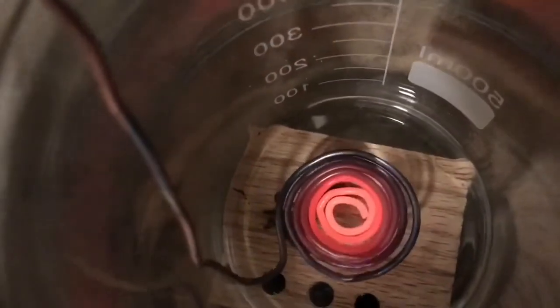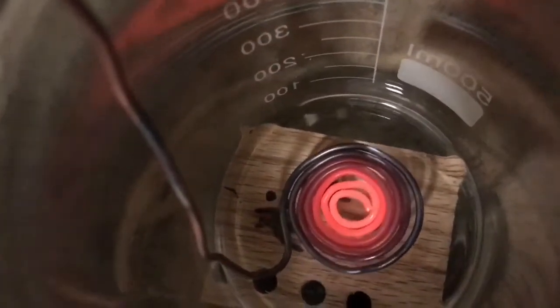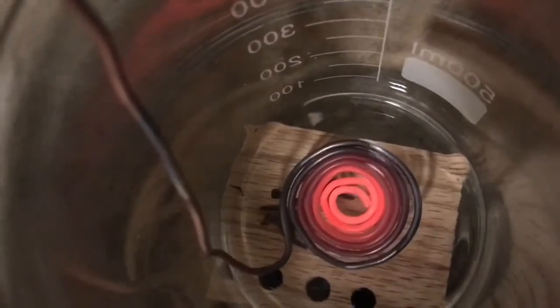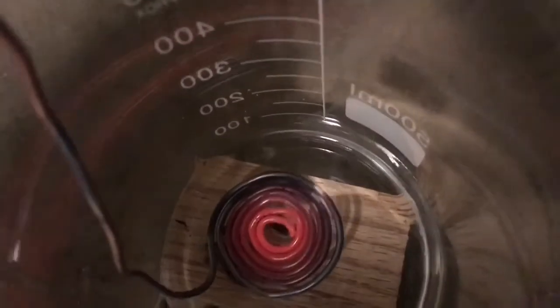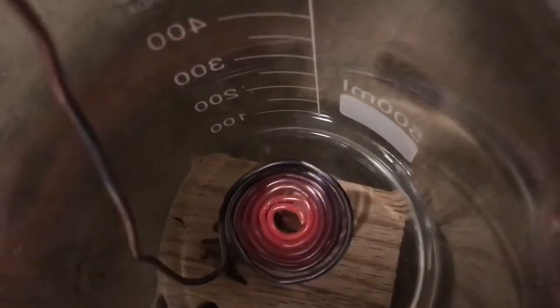Copper plus rubbing alcohol, catalyzing the decomposition of the rubbing alcohol. You can see waves of oxide forming on it and then decomposing.